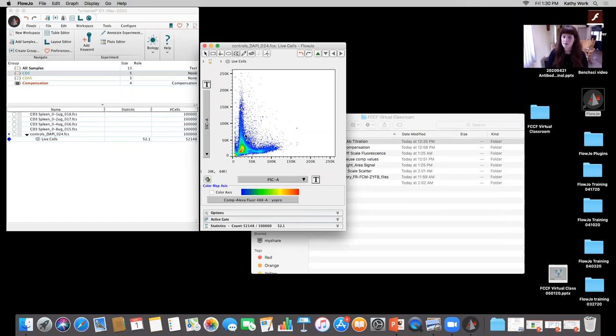It's a little bit hard to tell there where our debris is and where our cells are, rather. And what we can do in situations like this, and we have a flow posted on this, is we can actually include a marker to make sure that we're pulling out live cells, such as calcein or something like that. There are markers available to us to make sure that we have metabolically active cells that are pulled out and there aren't just debris or dead cells, right?